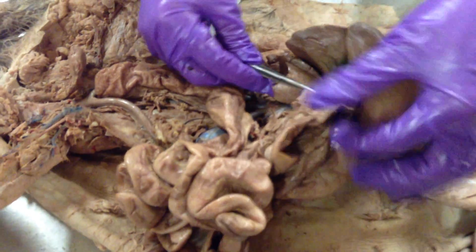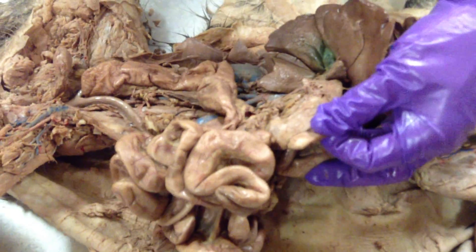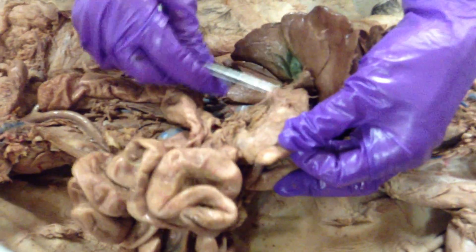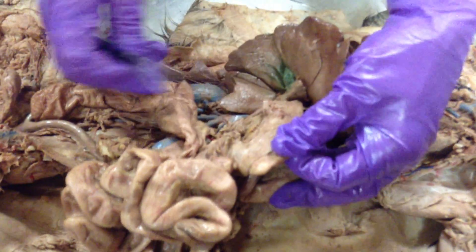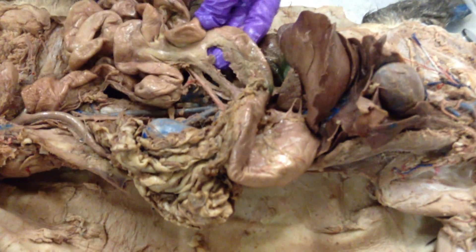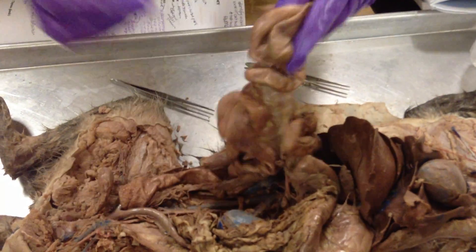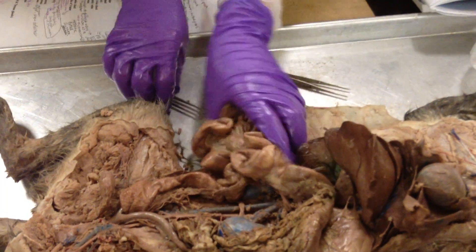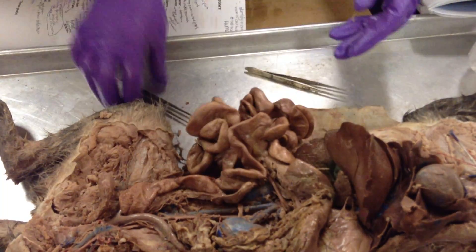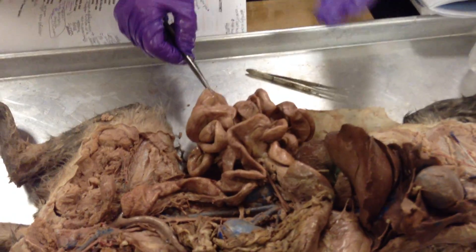Here's your pancreas — I know it's really hard to see on this cat, but check out the other cats, it's definitely visible. So: duodenum. The second part of your small intestine is the jejunum, and it's all of these curly structures. If it's kind of just out here and he points to it, it's jejunum.